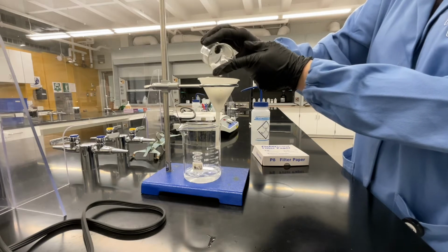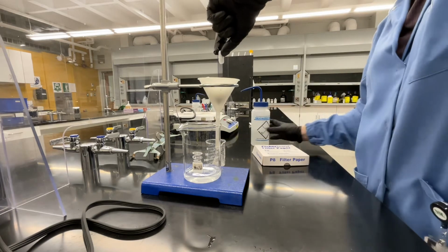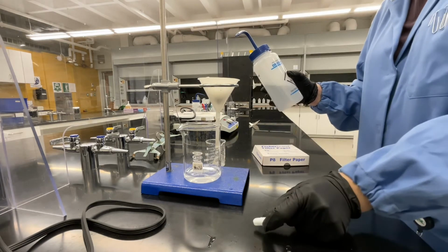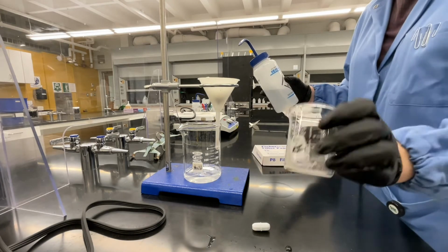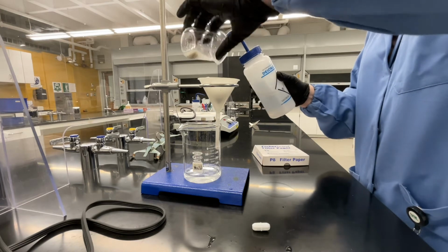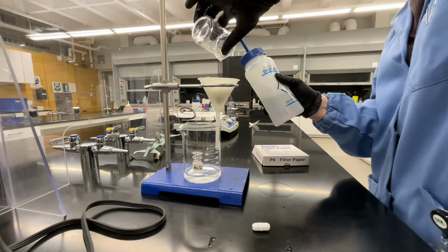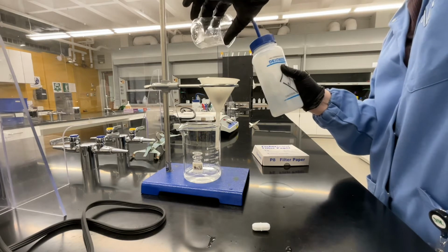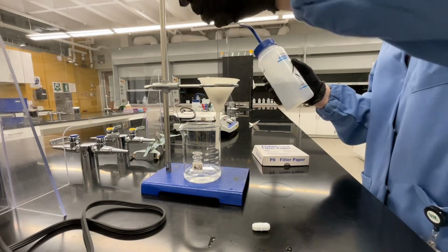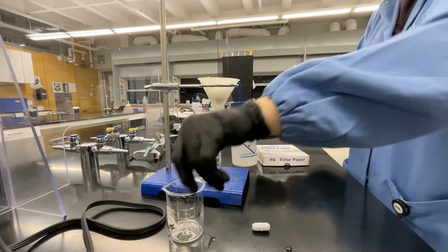Once your stir bar is mostly clean of solid, you can pour it out and catch it with your fingers. Make sure you're wearing gloves at this point. Rinse any residual solid off of the stir bar and set it aside. Continue to rinse your beaker until there's no visible solid remaining. Again, do this using as little water as possible because any water that we add here needs to be boiled off in the next step. Once you're satisfied that your beaker is clean, you can set aside beaker number 1.